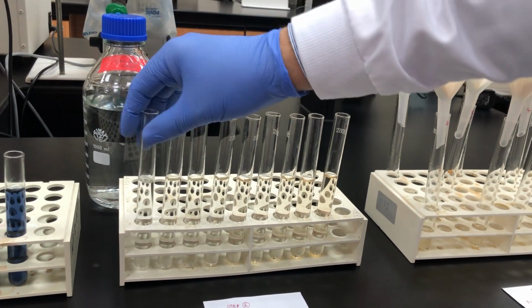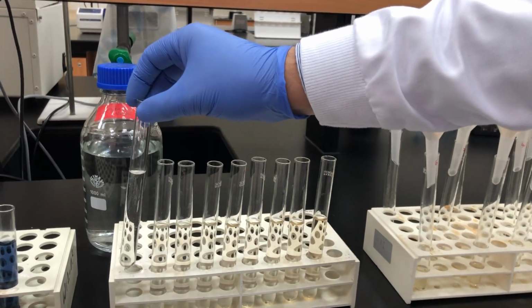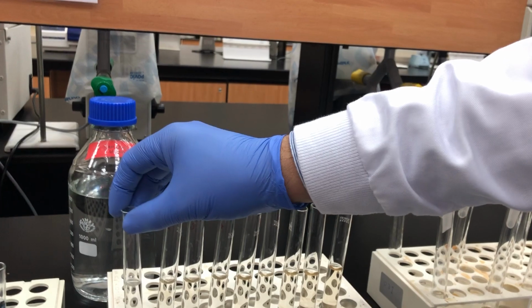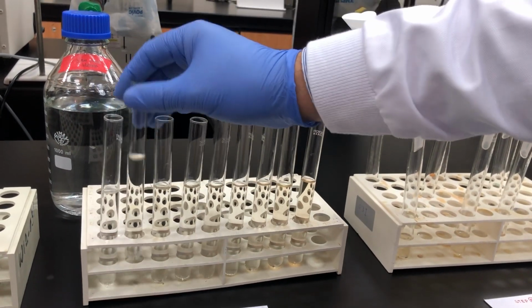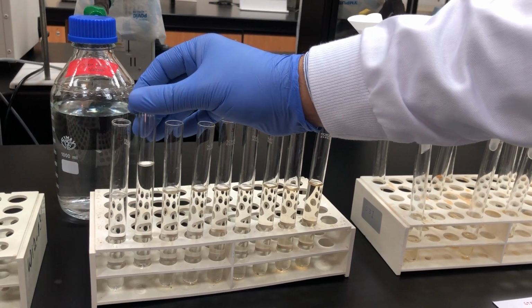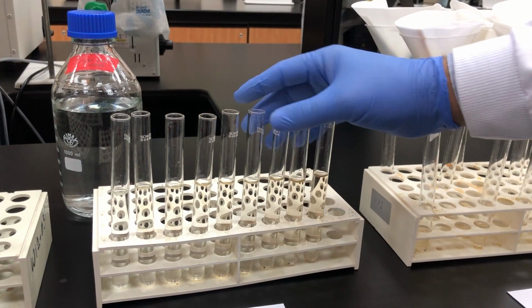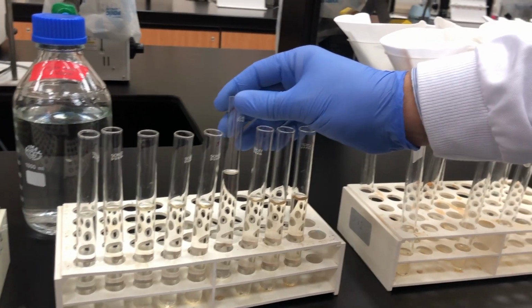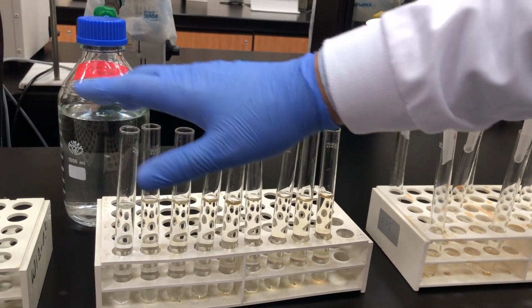Here, what will I have in this tube? Tell me. I will have 5 ml of filtrate plus 8 ml of NaOH. Is it clear, guys? Now I'm doing the media. So here in the second tube, I will have 5 ml of the second tube filtrate plus 8 ml of NaOH. The same here, tube number 6: I will have 5 ml of tube number 6 filtrate plus 8 ml of NaOH. So I will put the media.